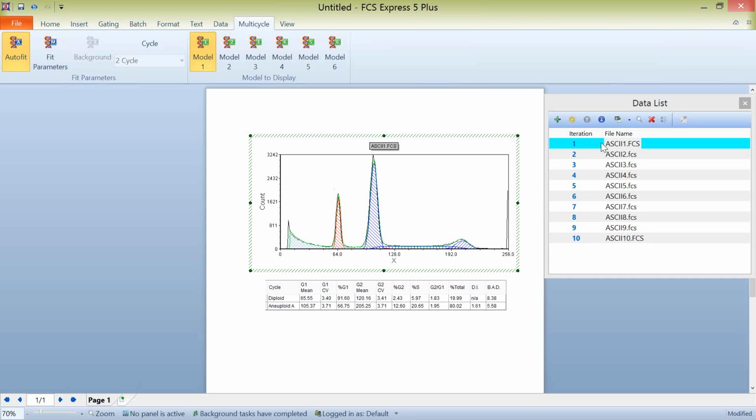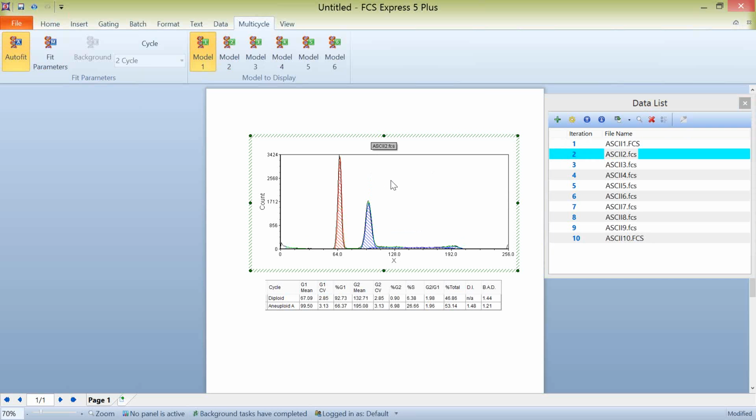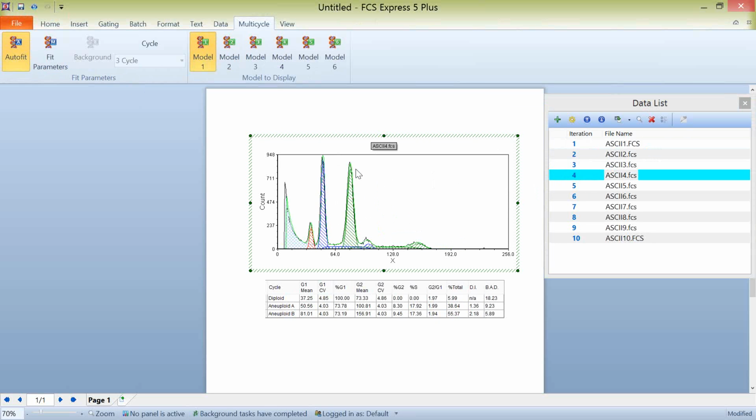And if you're working in the full version of Multicycle and you have these different populations and these changes between data files, as you navigate through the data list, Multicycle is going to automatically try and fit the data to these models using the cycle that makes the most sense. So as I continue on here through our data list, we can see, again, these are a lot of 2-cycle models. We get into something a little bit more complex where we've actually determined 2 aneuploid populations as well as a diploid population. But Multicycle is going to do its best to tease these things out for you. And if you're working with more than 1 cycle worth of data, using the advanced Multicycle, if you're working with aneuploid populations, it's going to be a great benefit to you as well.